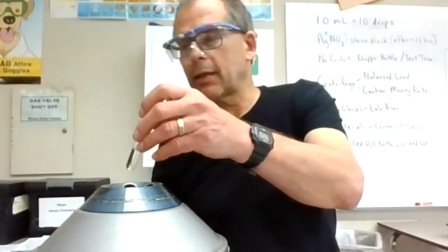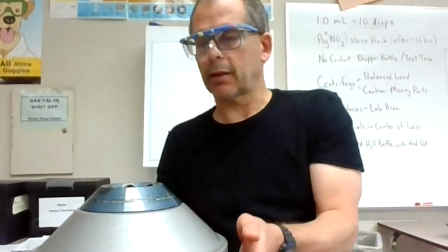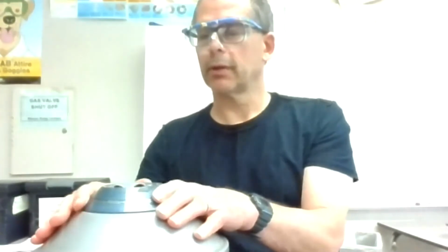I'm not seeing anything yet, but I'm going to double check and verify to see if it's going to frost that glass. Okay, we'll slow that down.